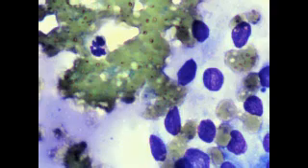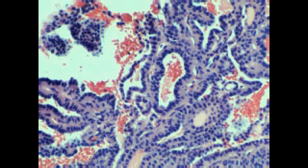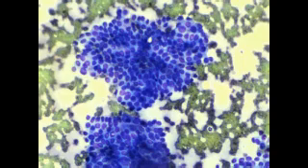It doesn't necessarily mean that in all PTC you would see all these features. You might be lucky sometimes if you have them all to give you the assurance, yes, we are looking at PTC. It's like a puzzle. We have to put all the pieces together in order to come up with one diagnosis. Of course, the treatment for this patient was thyroidectomy and hormonal therapy.